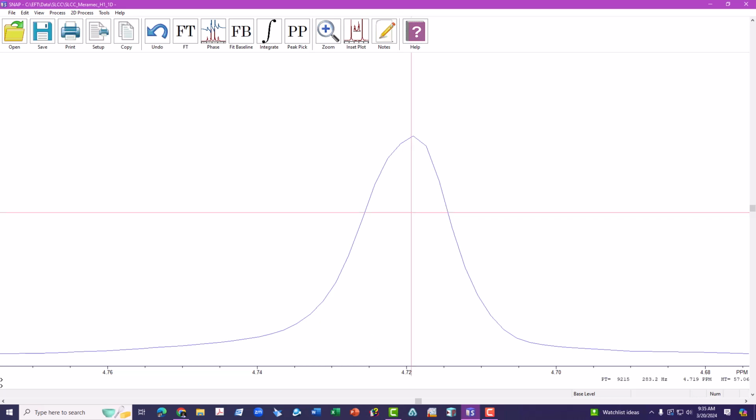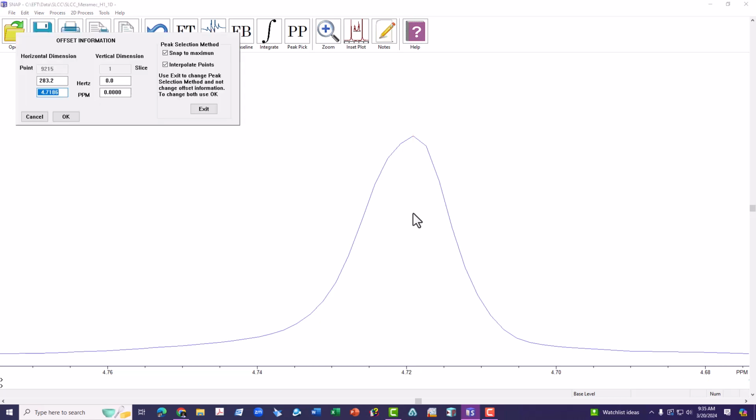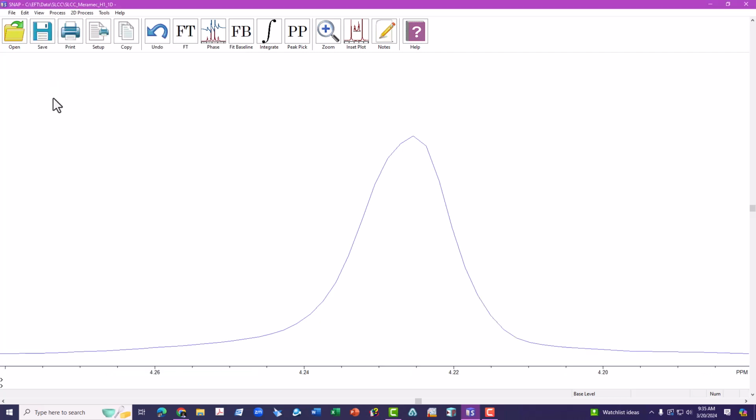Click and hold the mouse in the background so that the vertical line goes through the tallest data point that defines that peak. And while I'm holding that, I'm going to type the letter O on the keyboard, O for offset information. You'll notice that the current chemical shift of that line is 4.7186. Let's change it to 4.225. You notice that on the screen, the chemical shift now reads 4.225.